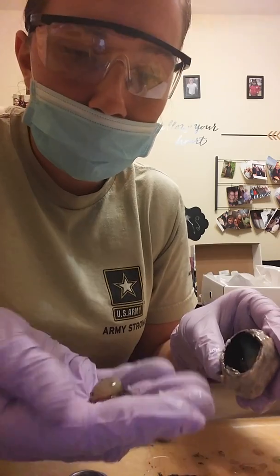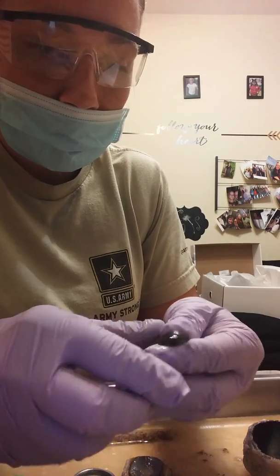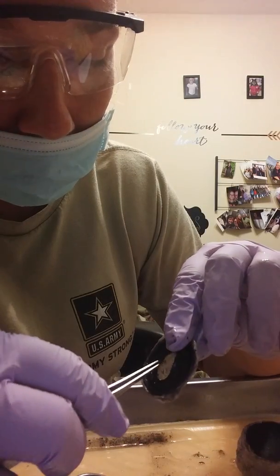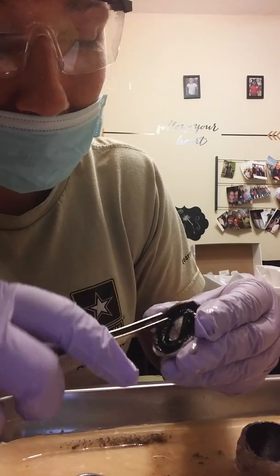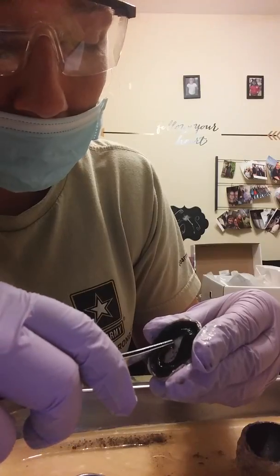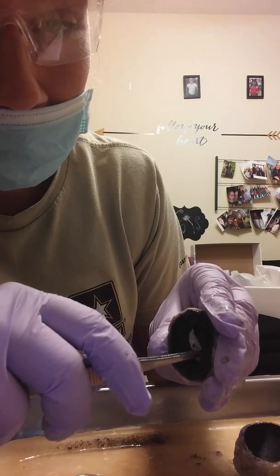Alright, so this ball right here, it would have been attached to the back of the cornea right here. This is the lens, and it's got some of the fluid on it. That's the lens, and then, let's see here. This black piece right here, this shinier fluid, it's surrounded by some striated material, but this flatter, shiny material right here that has a circle in the middle, this is going to be the iris. And then the hole in between that, it would be the pupil that the iris constricts. And then the front portion again is the cornea. Between that cornea and the pupil would be the anterior chamber.